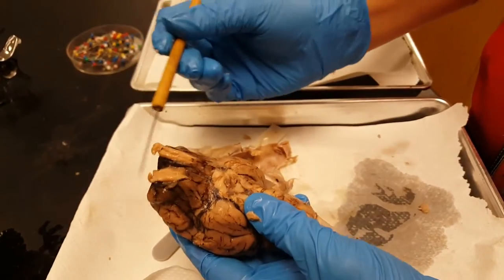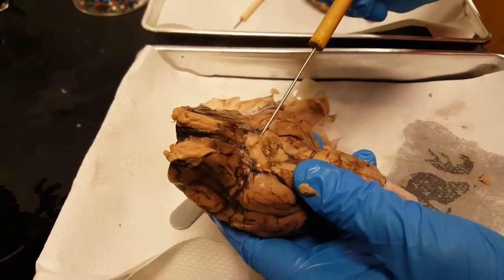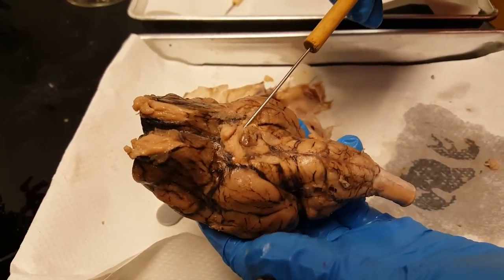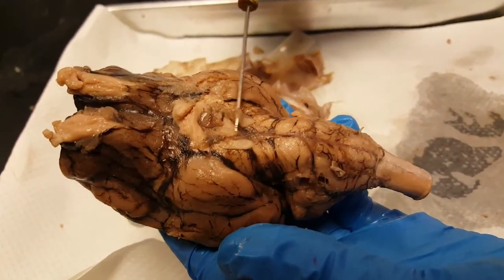On the underside, these two are the olfactory nerves. Remember where the two optic nerves crossed? This is what's left of them at the optic chiasma. If you're lucky you'll even end up with these two little nerves — those are the oculomotor nerves.